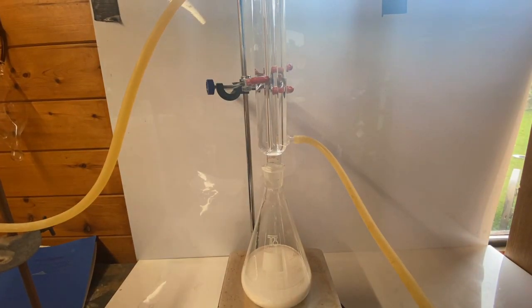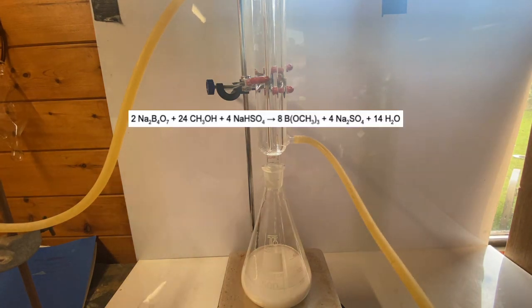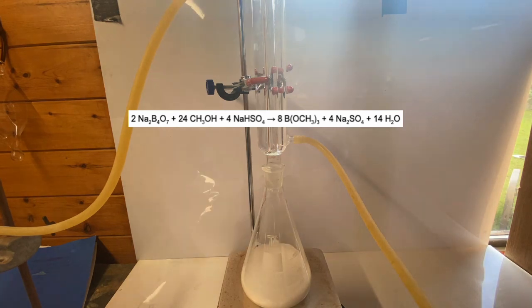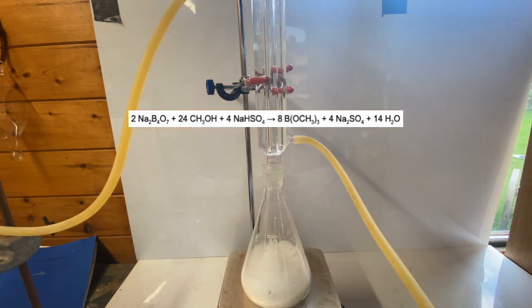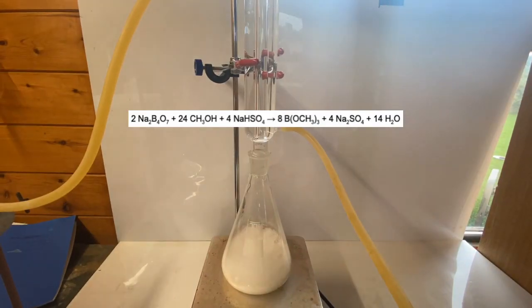Reflux was set up for half an hour to allow everything to react. What's happening here is the borax is reacting with the methanol and sodium bisulfate to make trimethyl borate, sodium sulfate, and water.